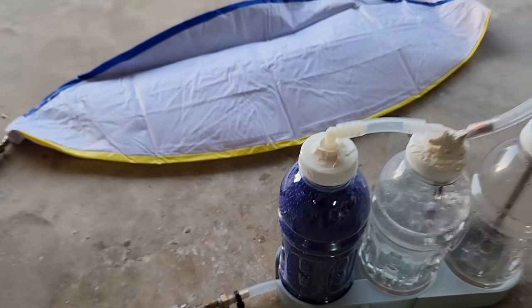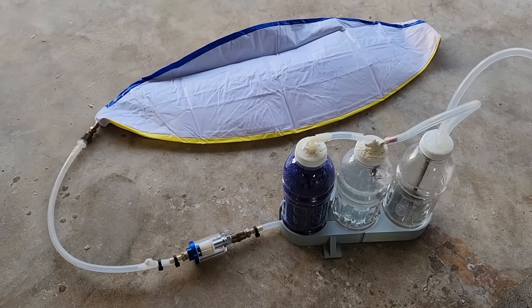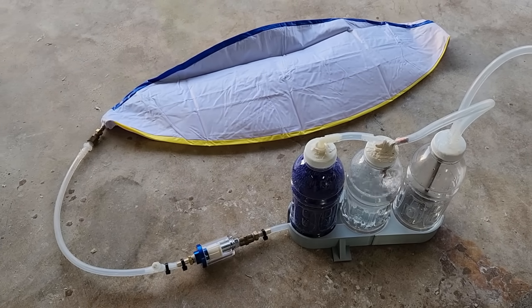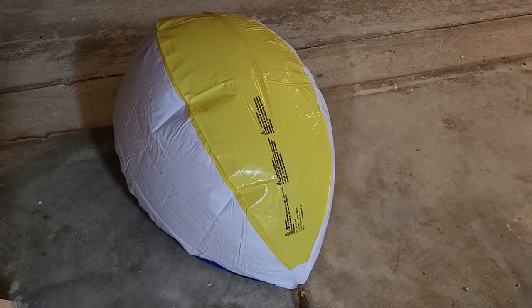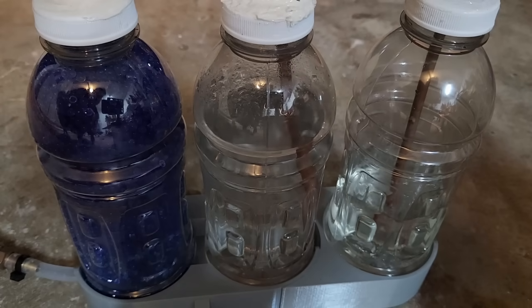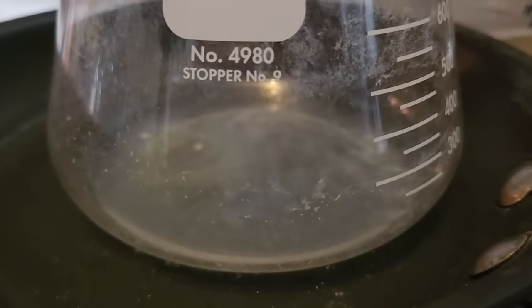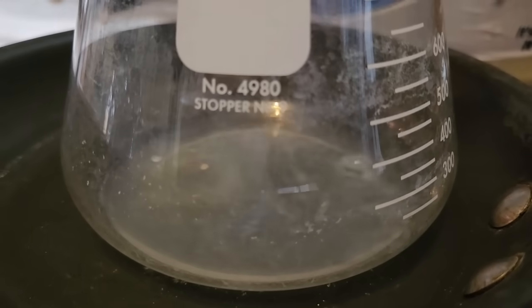Now it's time to actually collect and store the gas. To do this, I hook up a beach ball to the output tube, same as I did in my dry ice video when I was collecting CO2 gas. Here's the beach ball after one hour of running. Fully inflated it carries around 120 liters, so I'm guessing there's about 50 or 60 liters in there right now. After an hour and a half, the bubbler output was looking much weaker because I had pretty much used up all my alcohol — I started with 500 cc's in the flask.